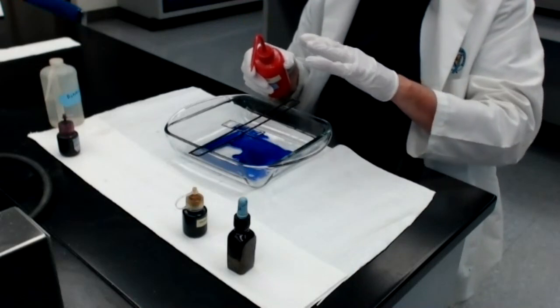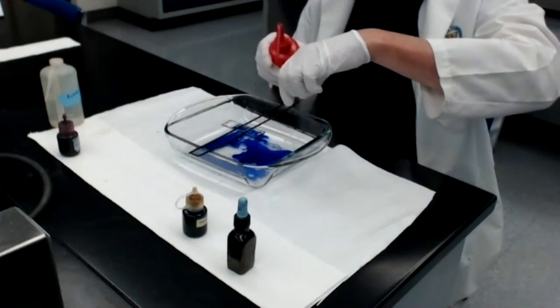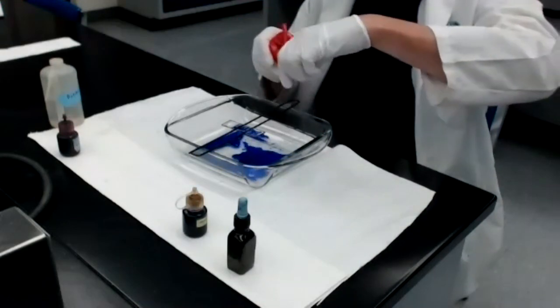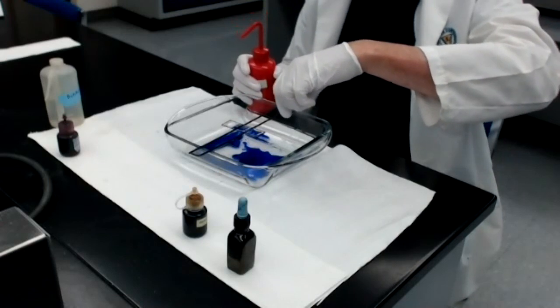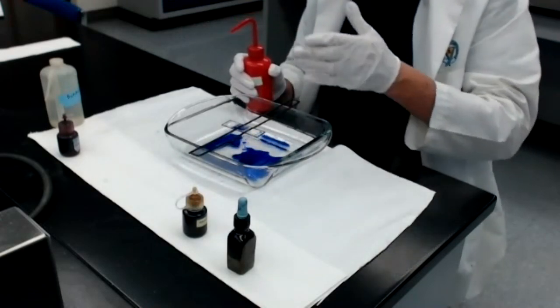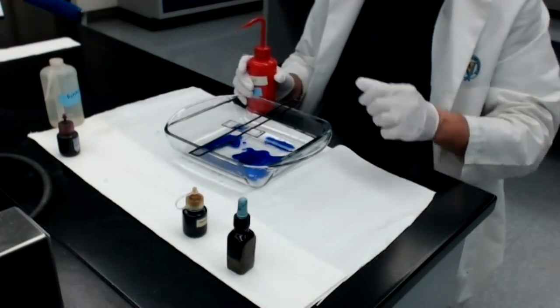At the end of 20 seconds, I then will grab the slide, tilt it, and begin washing the slide with more acetone so that the acetone is dripping off the end of the slide into the staining dish. And I'll do that for about 10 or 12 seconds. And then I will immediately wash the slide with distilled water and go on to the next step, which is addition of the counter stain called safranin. Okay, so here we go.